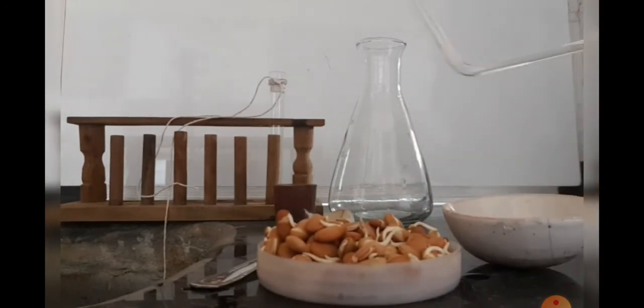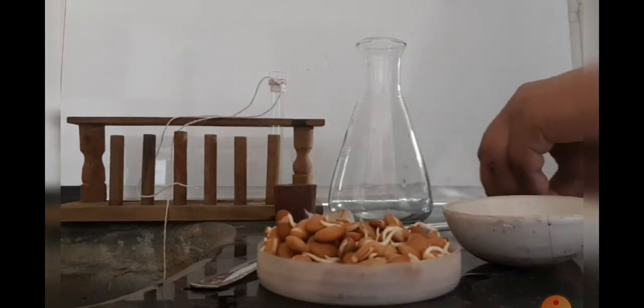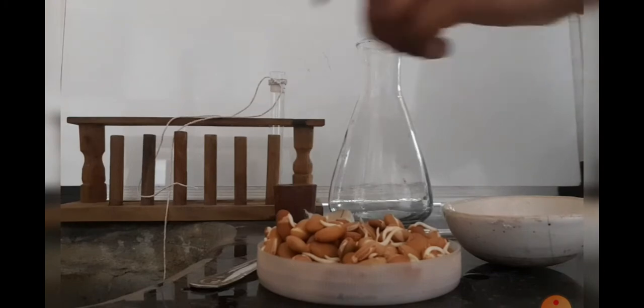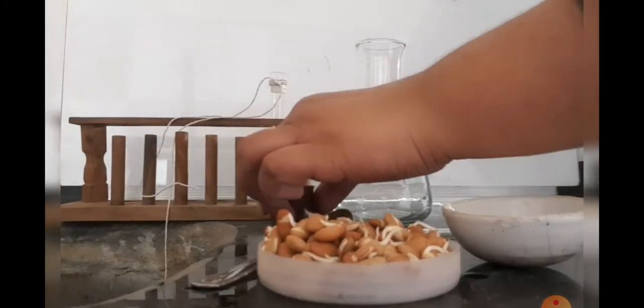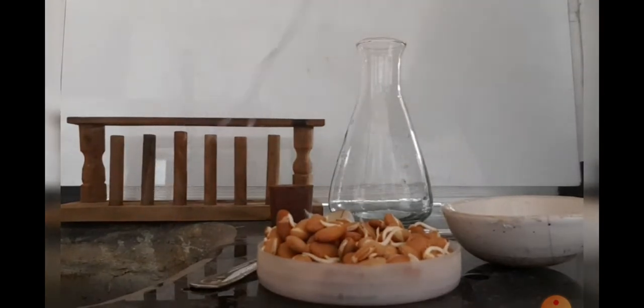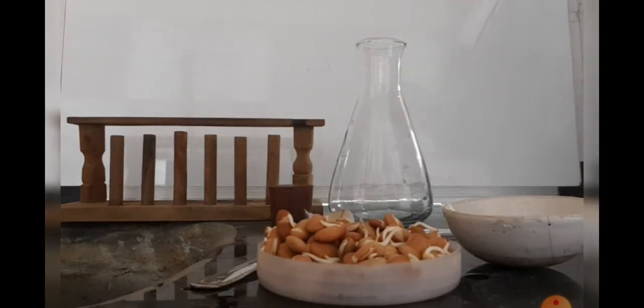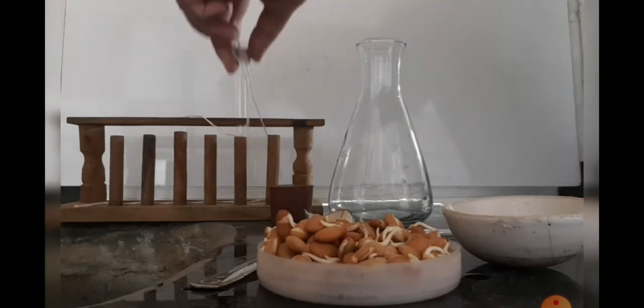Here you can see in this dish there are pellets of potassium hydroxide. We need a bent tube to pass gas, a conical flask, rubber cork, spoon, and a test tube — on this test tube we have to tie a thread.